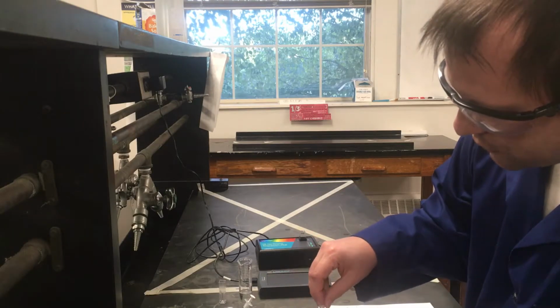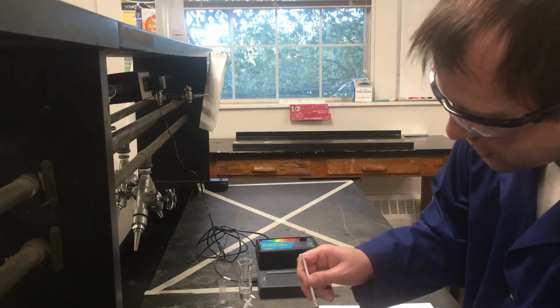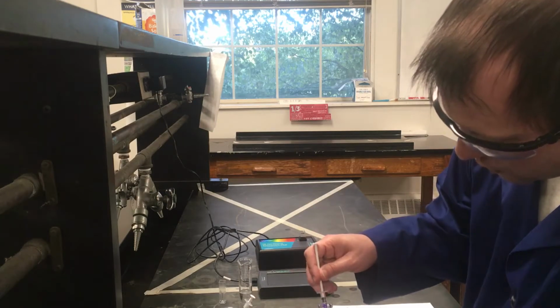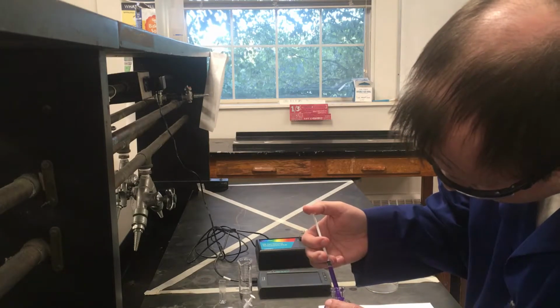For this crystal violet solution, you do want to be a little bit careful in handling it. It's not going to cause any kind of long-term harm or damage to your skin, but it will stain your skin and it will stay stained for a while. Unless you want purple streaks on your skin, you do want to be at least a little cautious as you're handling it.